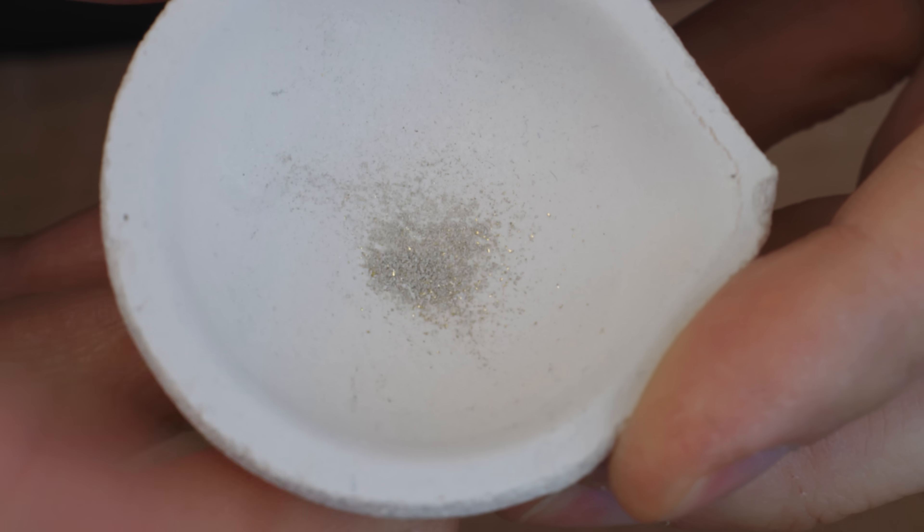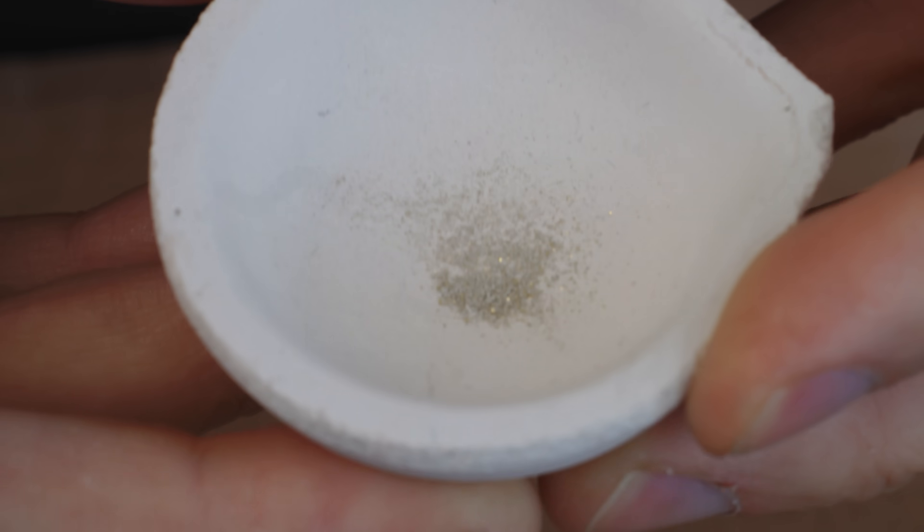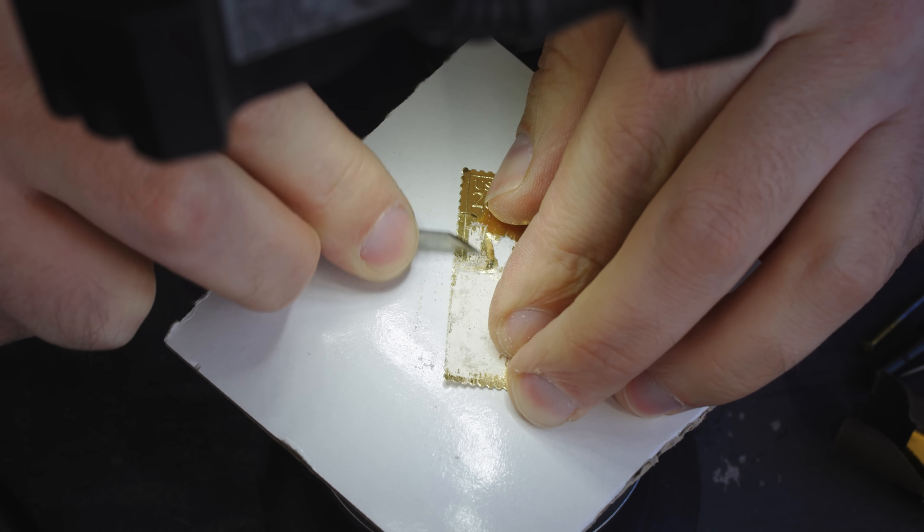Yeah, you can actually see that there's little tiny gold specks inside the crucible. So with that, I'm just going to simply continue the mission of scraping off these stamps.